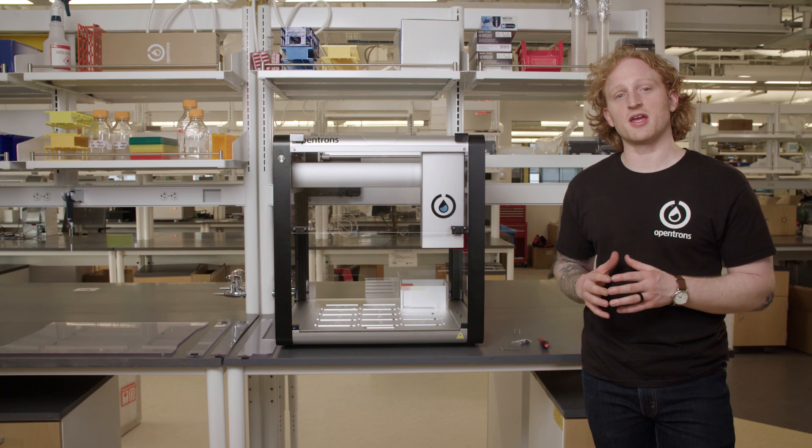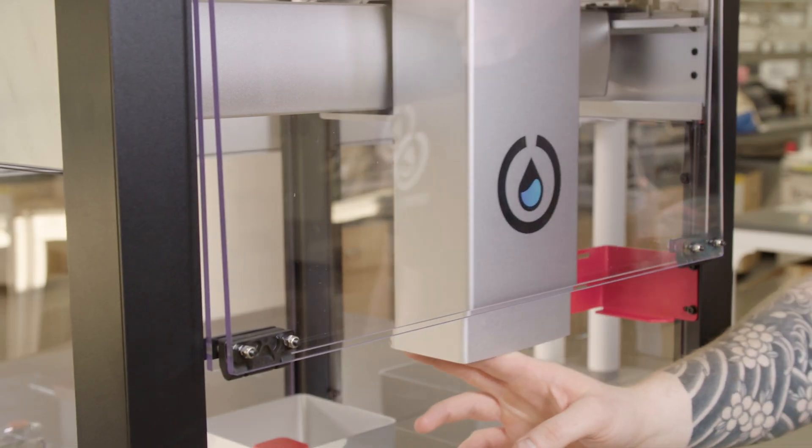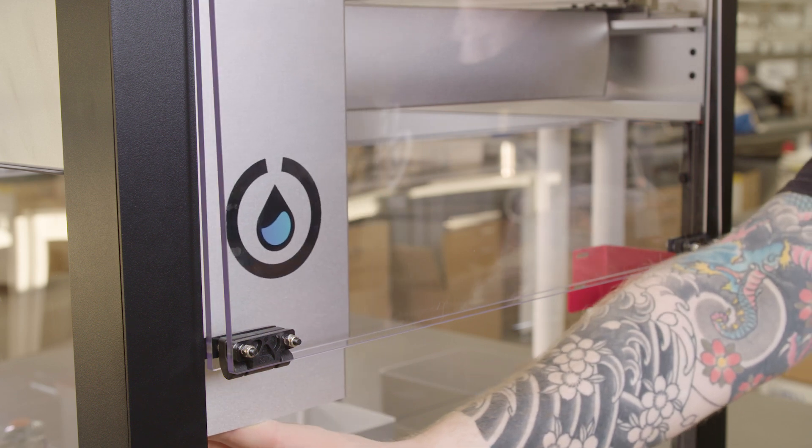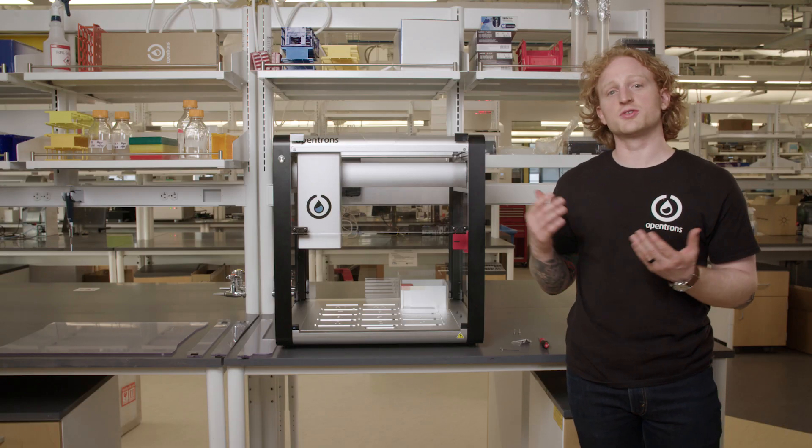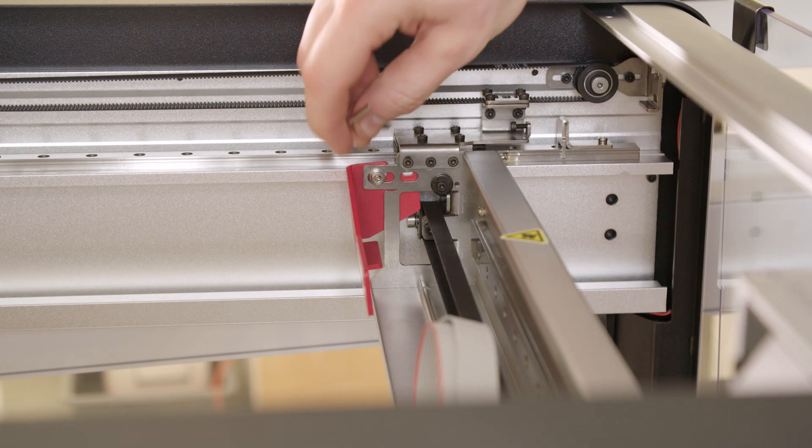I am going to move the pipette carriage to the other side of the OT2 for the time being, and I will unscrew the third screw from the Y rail.